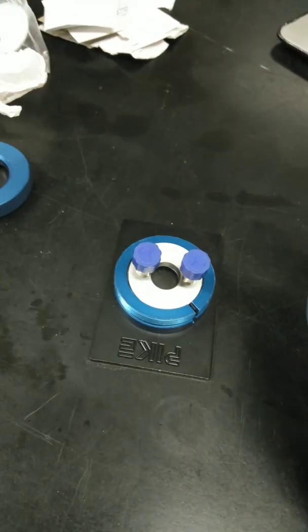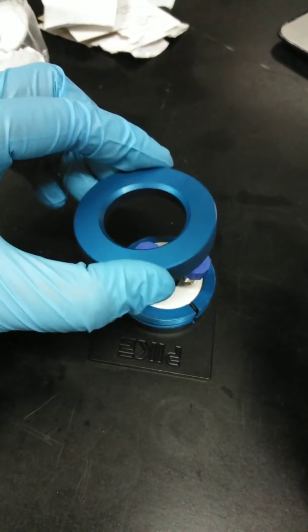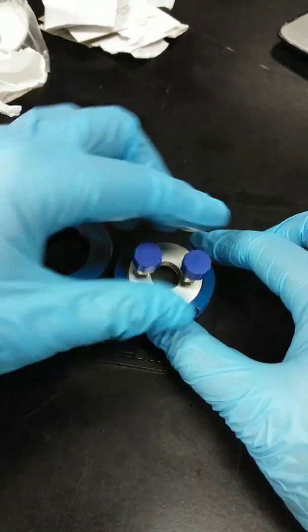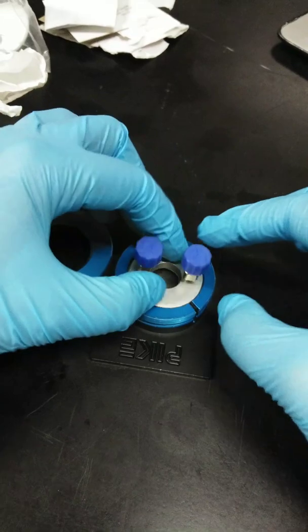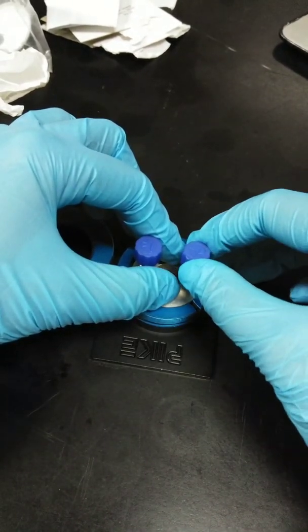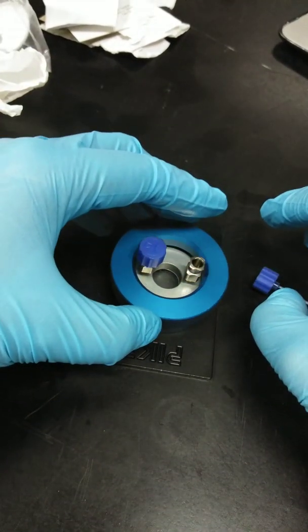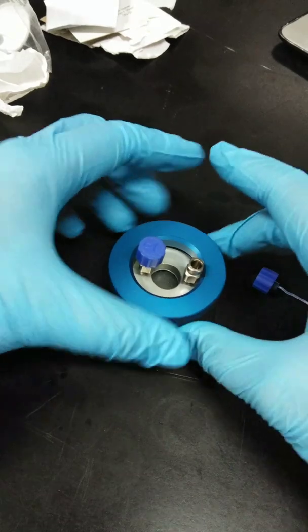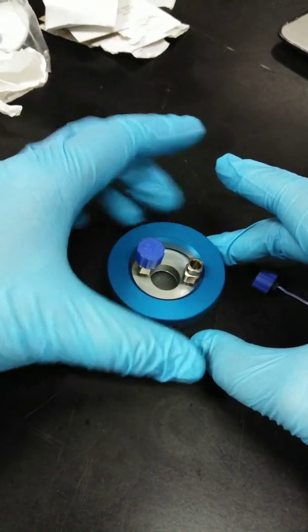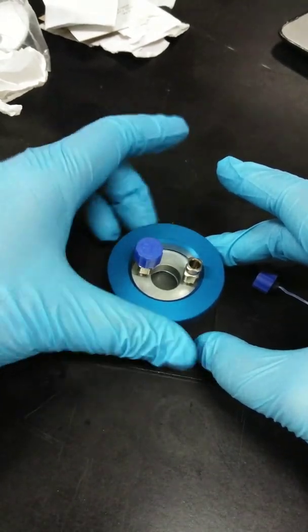Next is, we have to place this end cap on top of this. But, of course, before we can do that, we have to remove this stopper. So the main reason for placing the stopper first is to guide your cell first. So let's remove this so that we can put the cover. So the last thing is to screw on the end cap tight.